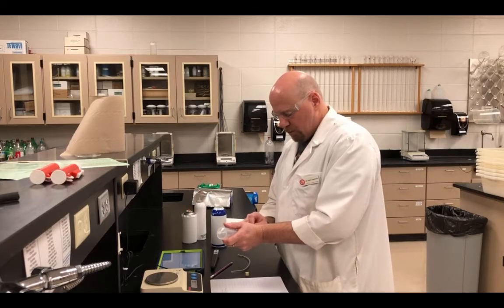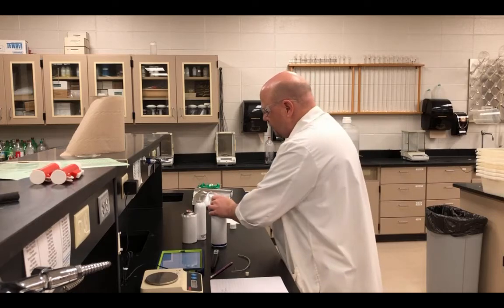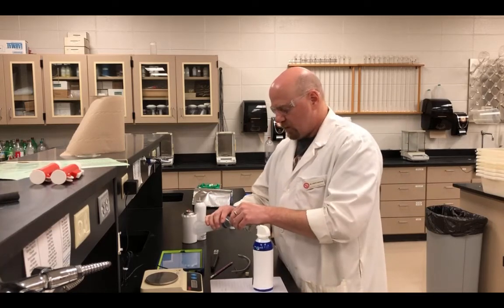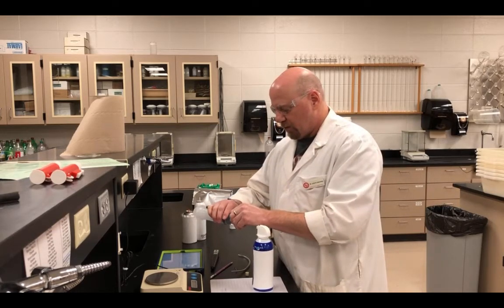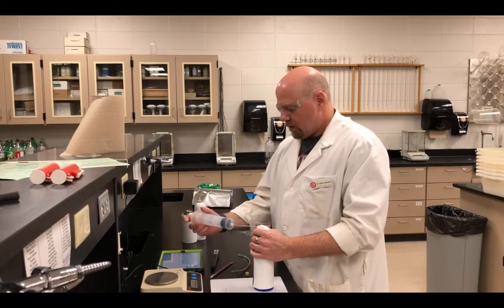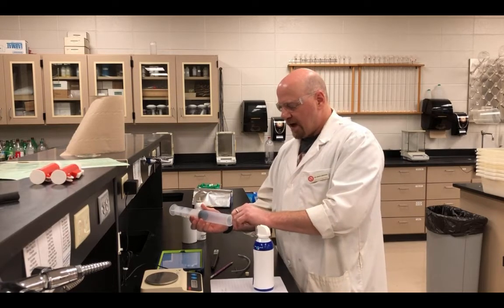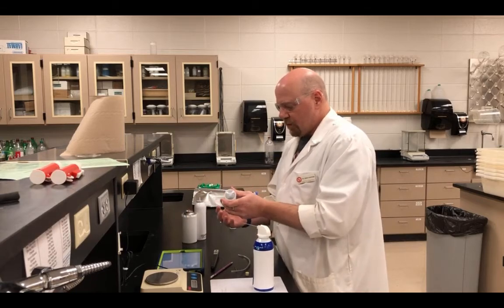I'm going to fill it with the gas. Fill the syringe up twice and then a final time to make the measurements, to purge it, and make sure the only gas that we are collecting is the one from the can.